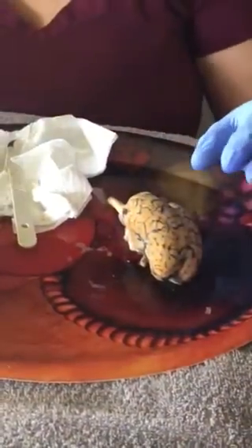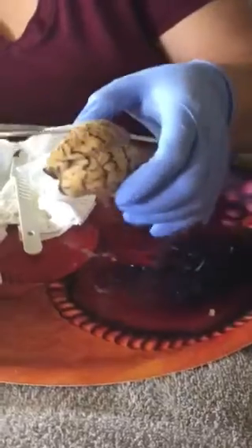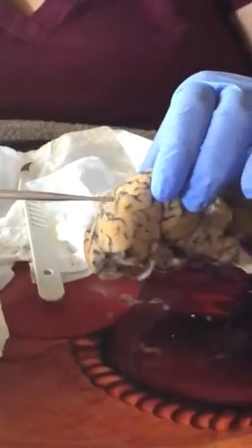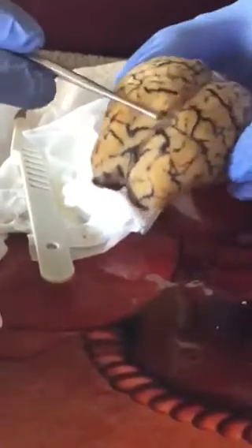Next, I will be going over what a gyrus is. A gyrus is the ridge fold between two clefts. So it's like these folds, if you can see them here. They're supposed to be more like folds in between. So this is one, this is another one, in between the lines. And then the grooves in between them, that's the sulcus. It's a groove or a furrow. It's like a line kind of dented in.